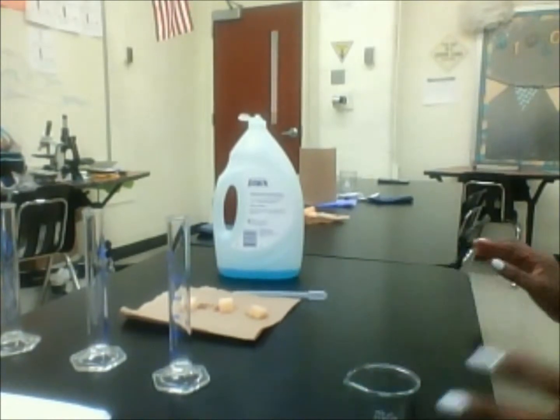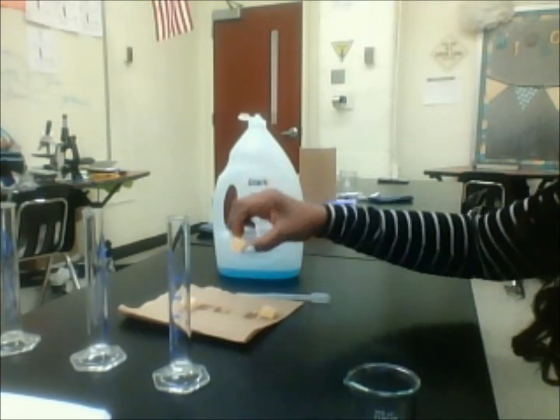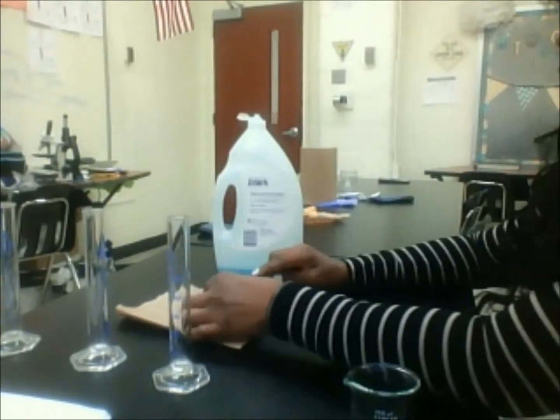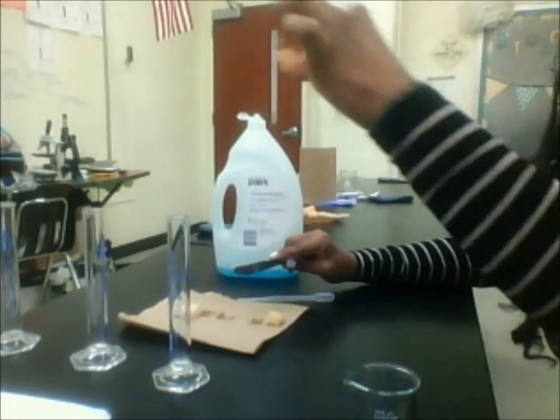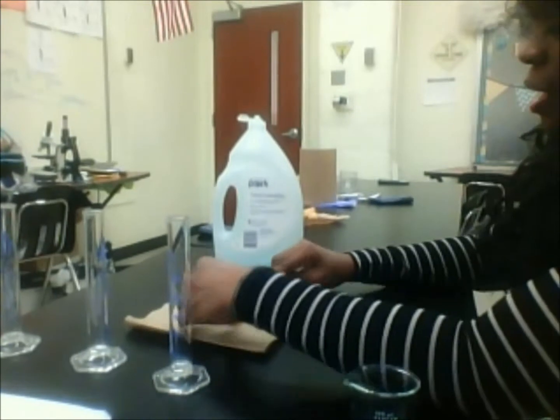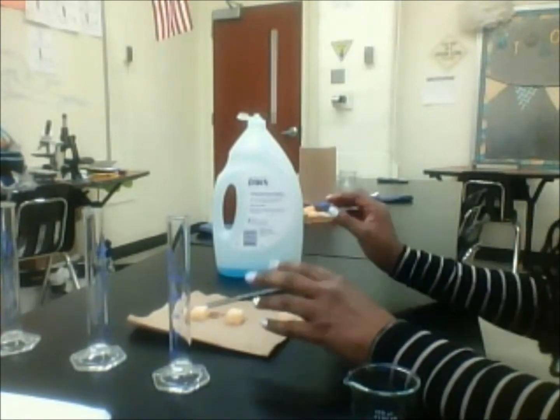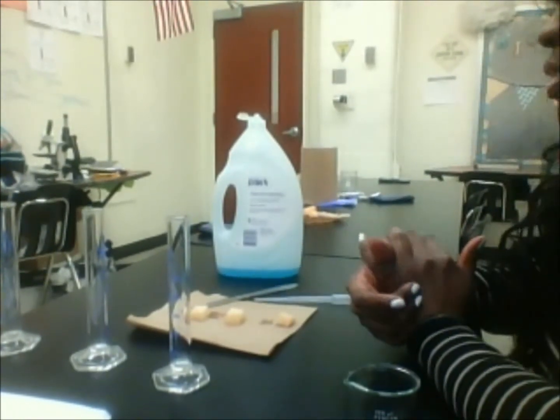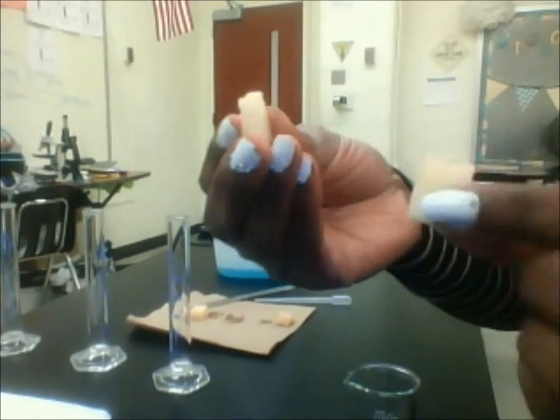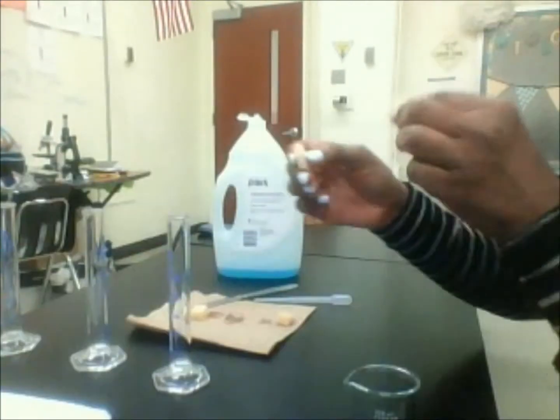Next, we left cube 1 alone. For cube 2, I'm going to cut it straight down the middle in half. A good rule of thumb, even though you're measuring 1 centimeter by 1 centimeter by 1 centimeter, is to also weigh these before you cut to make sure they are the same weight. So I took cube 2 and cut it in half. This is cube 2 that has been cut in half.